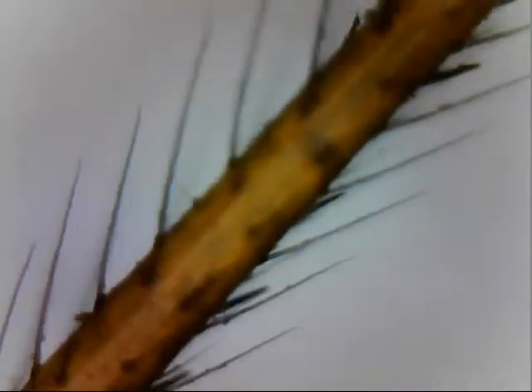Well, wrong direction. That's the metal on the bottom. I'm trying to get this fuzzy thing on the top, right? It's hard to control this because everything's backwards. I'm trying to get this into focus. It's orange, and I don't like it.